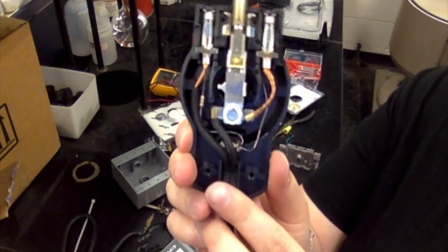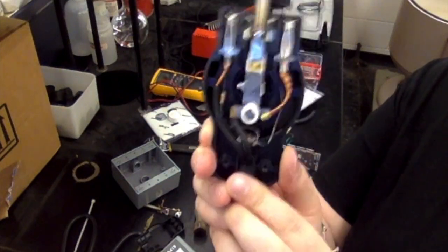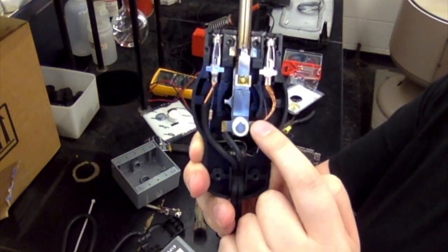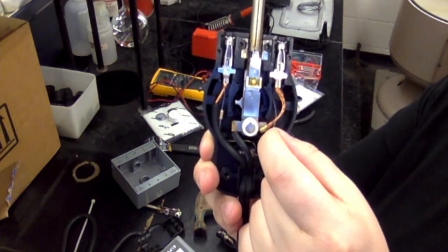This is what the inside looks like before we make modifications. What we're going to do is cut this black line here, and cut this line here, and then we're going to solder them together.